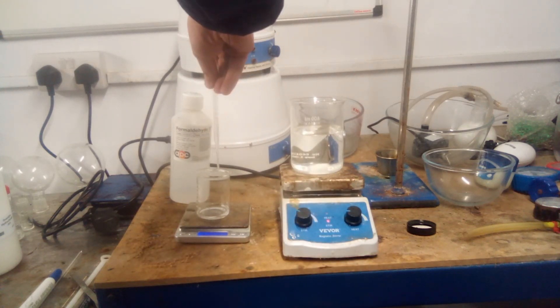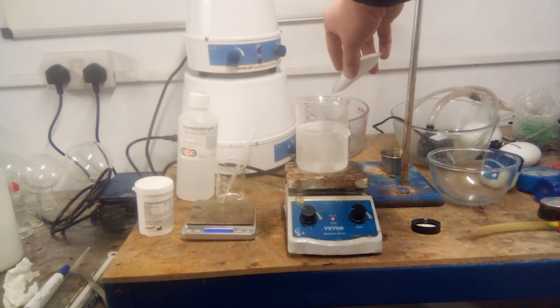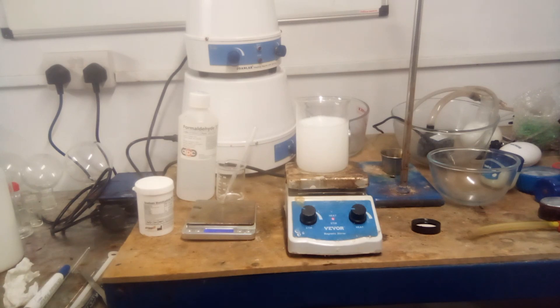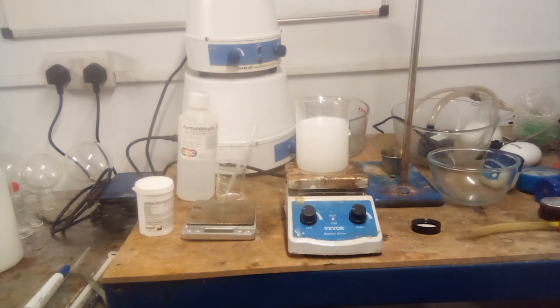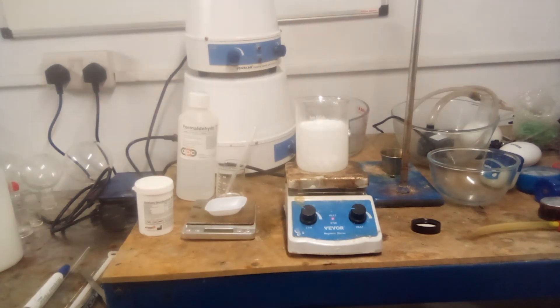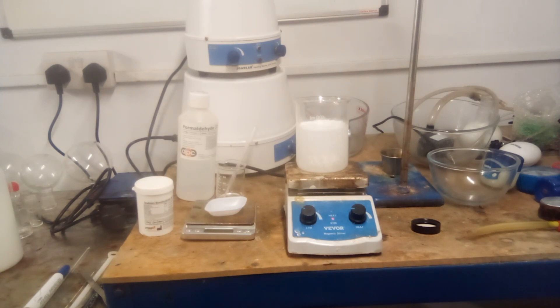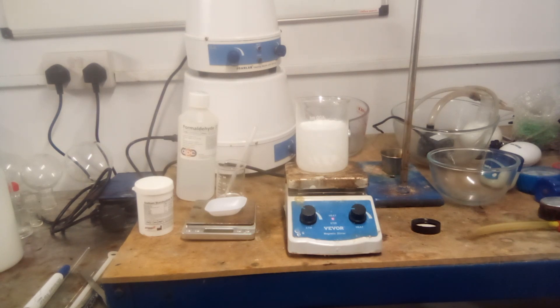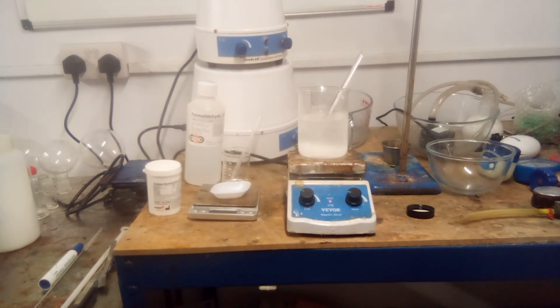The intermediate takes 10–15 minutes to form fully. After this, the first portion of sodium borohydride was added, causing a lot of effervescence and a little heating. In the original paper, water was used as the only solvent, but I found an alcohol-water mixture works better, as this caused the borohydride reduction to complete more quickly and more cleanly. The reaction was also less exothermic than it was with water alone. The addition of borohydride and the subsequent reaction caused the pH to rise to about 9, and big coarse lumps of insoluble salt precipitated. The mixture was stirred for 30 minutes, after which the pH was adjusted to around 7 using concentrated hydrochloric acid, about 3ml in total.